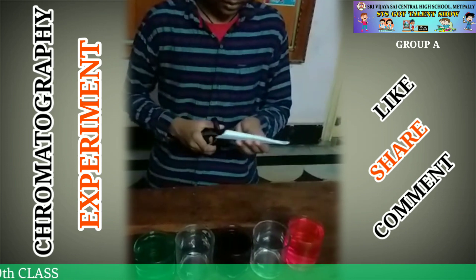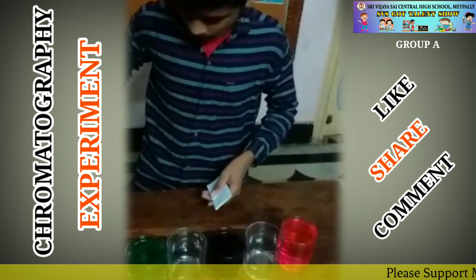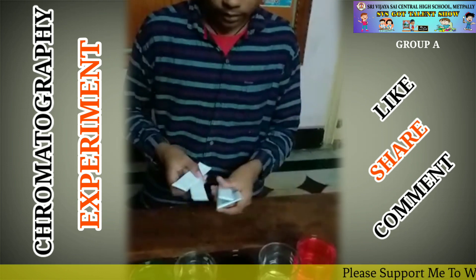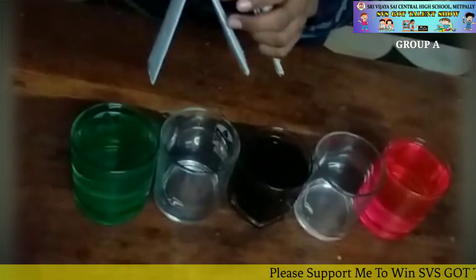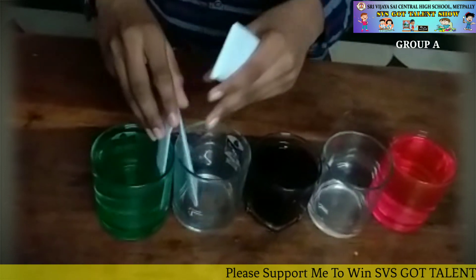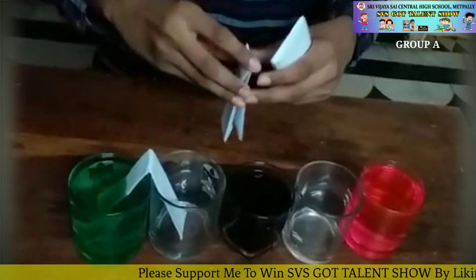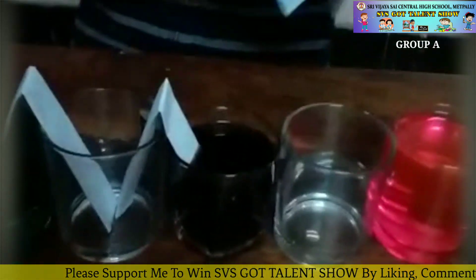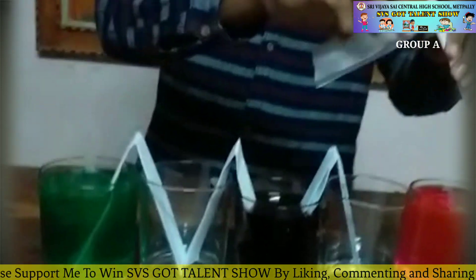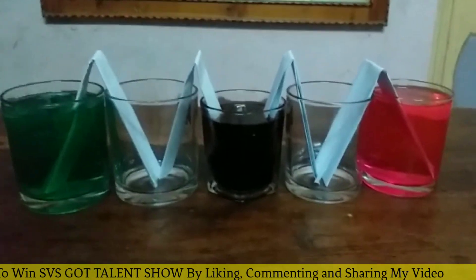I cut the papers. We have to prepare folds like this with the papers and carefully adjust them in place.